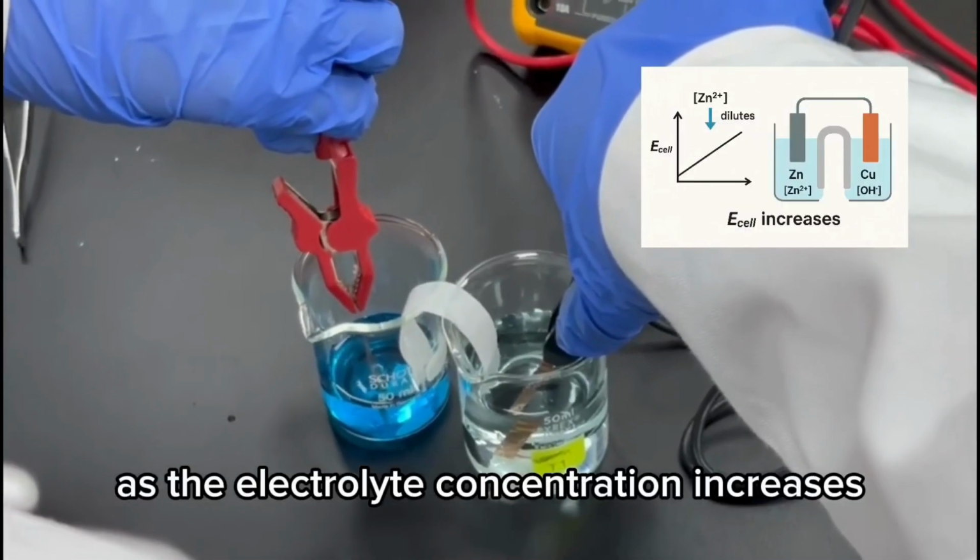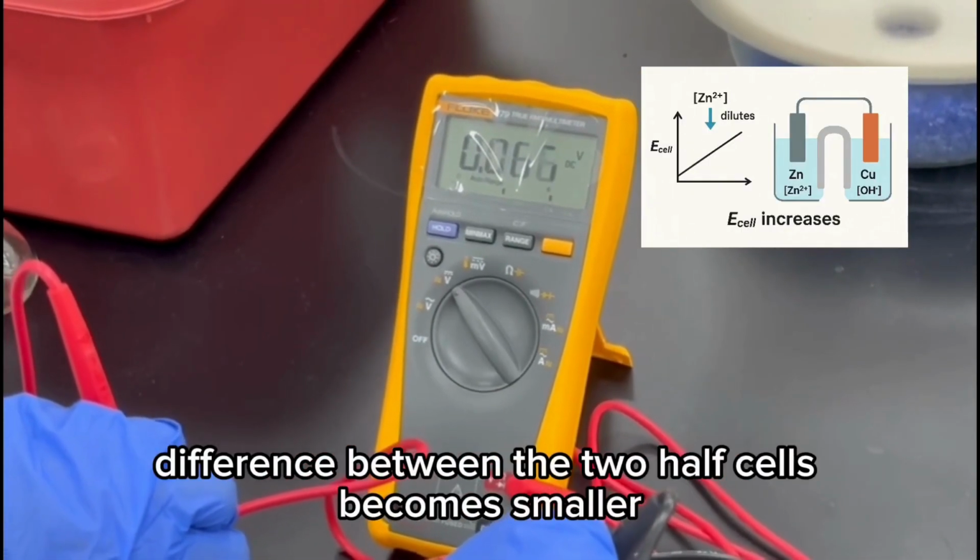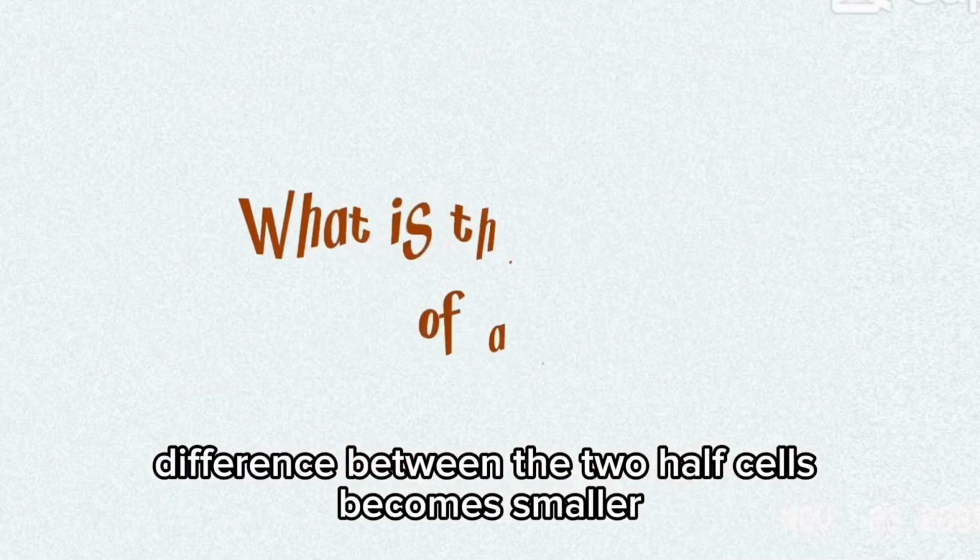As the dilute zinc sulfate concentration increases, the cell voltage decreases because the concentration difference between the two half cells becomes smaller.